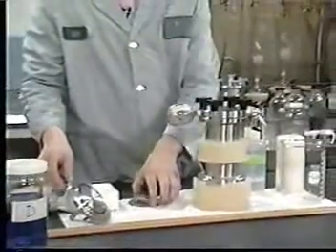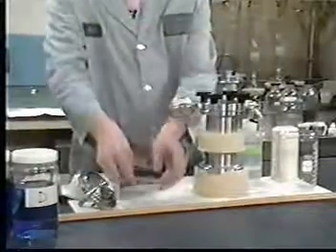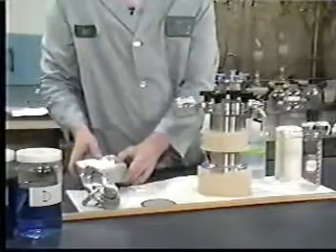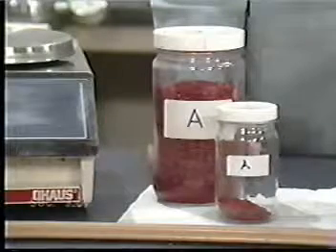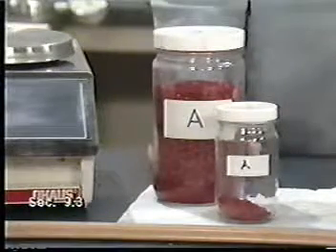A 90mm glass fiber filter is placed between the stainless steel support screens. The filter screen assembly and the liquid inlet-outlet flange are set aside until they are ready to be used. Determine the sample size needed to charge the ZHE from the percent solids of the waste.